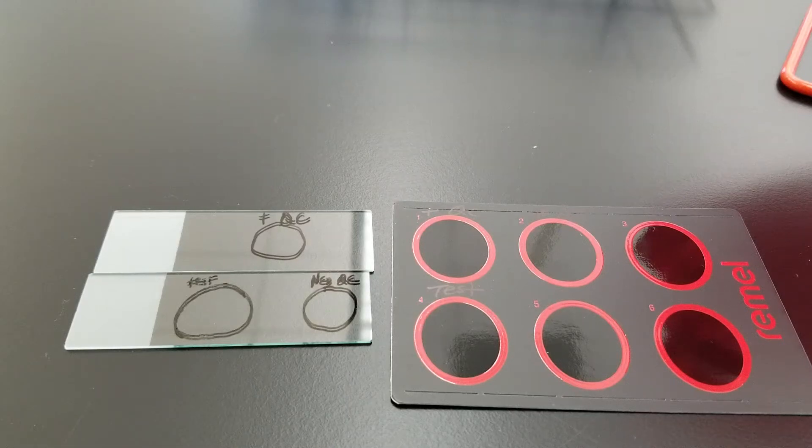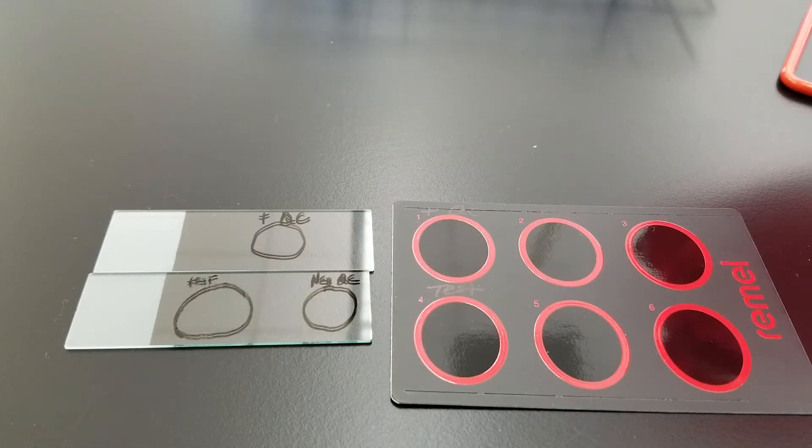Today we're doing the slide coagulase test for an organism that is suspected of being Staphylococcus aureus.